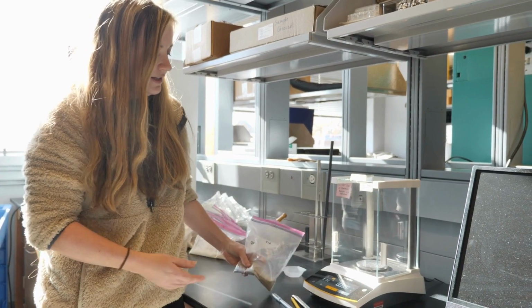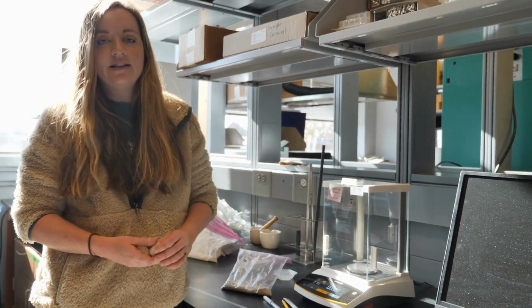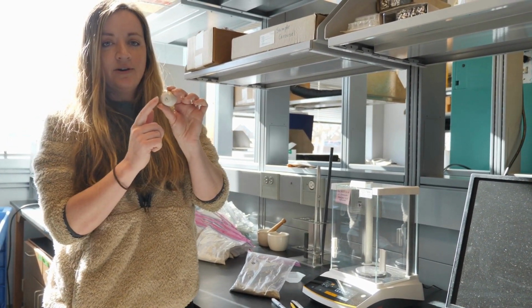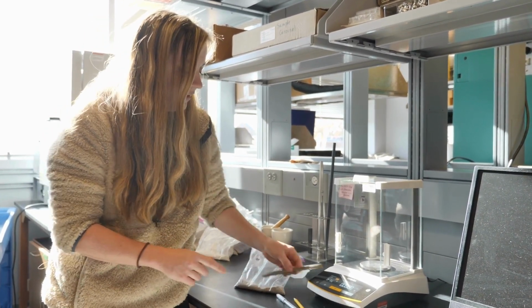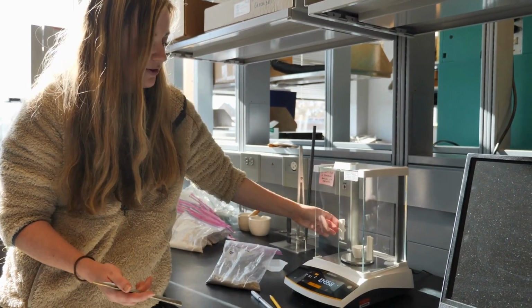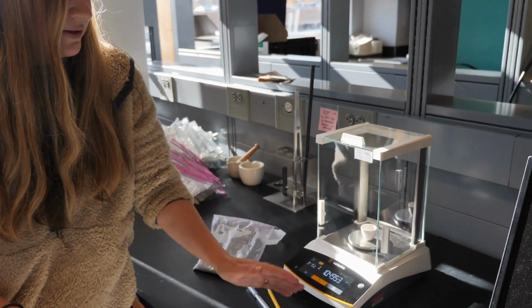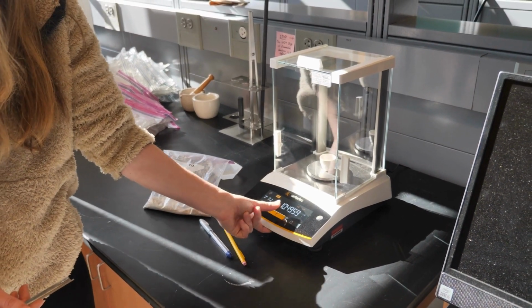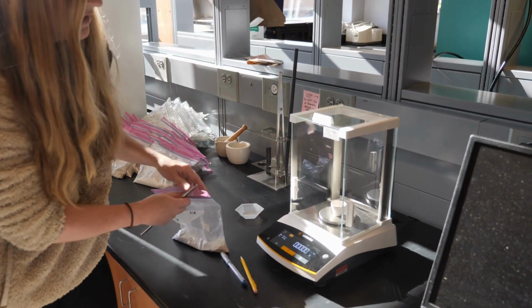At that point, you'll come over here to our analytical scale. And there's a few supplies you'll need. One is crucibles. You'll want to note the number or the specific ID of each individual crucible. And the first weight you need to collect is that of the empty crucible. Once you collect the weight, write this down in your notes, and then tare or zero out the weight of that crucible until you have a consistent zero.